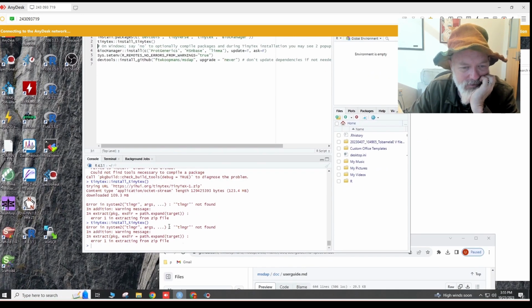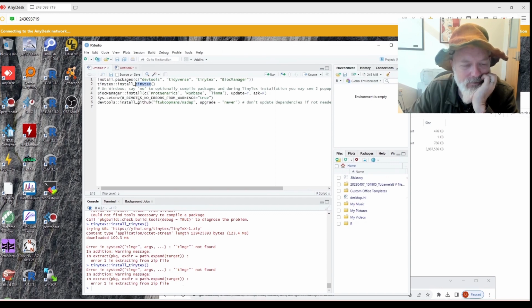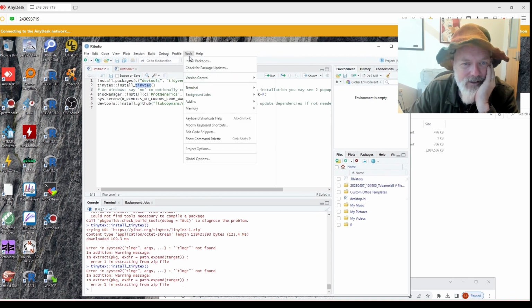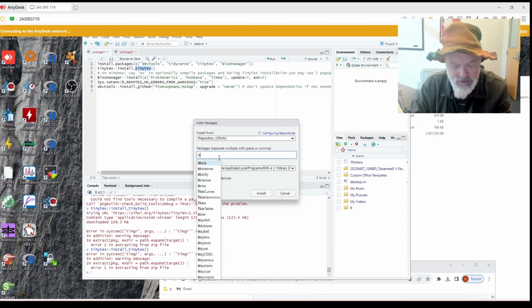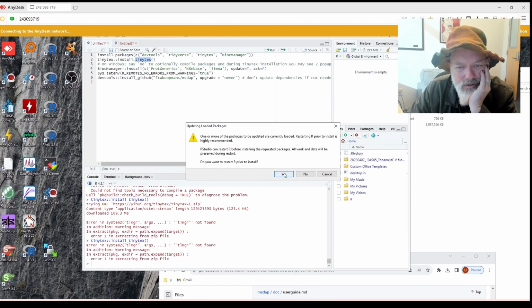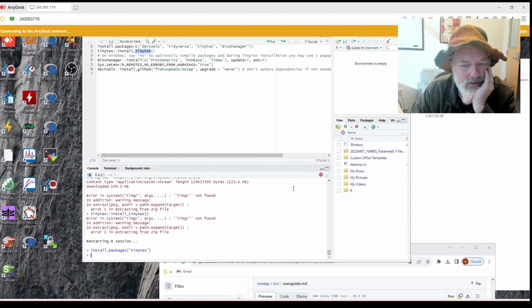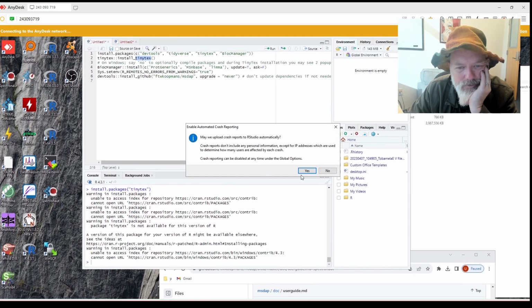Now, why did it fail again? TinyTeX not found. So these are the kind of problems I have with R. It gives me all sorts of errors in system TL manager not found. I don't know what that means. So install packages. I'm going to do TinyTeX like this, tinytex install. I guess so. Okay, so now is it installing it? It's still working on something. May we upload crash reports. Yes.